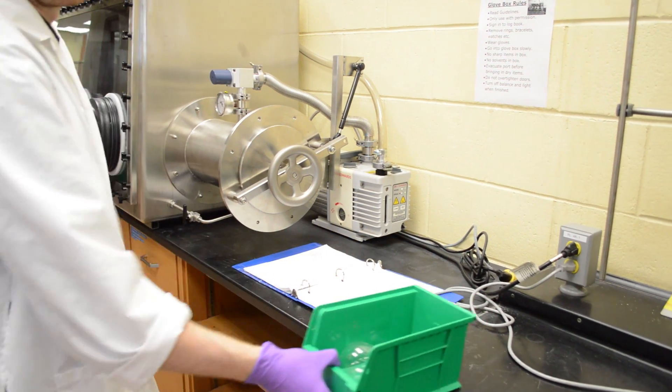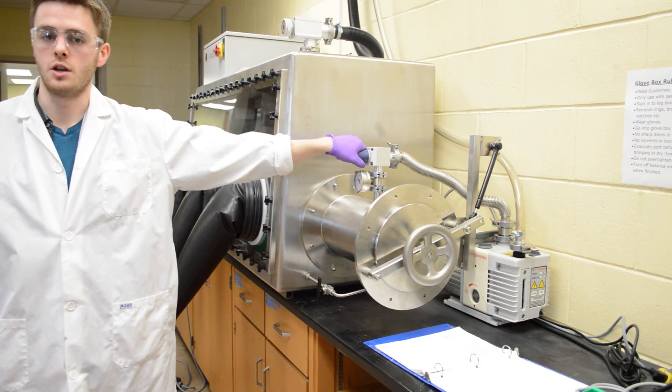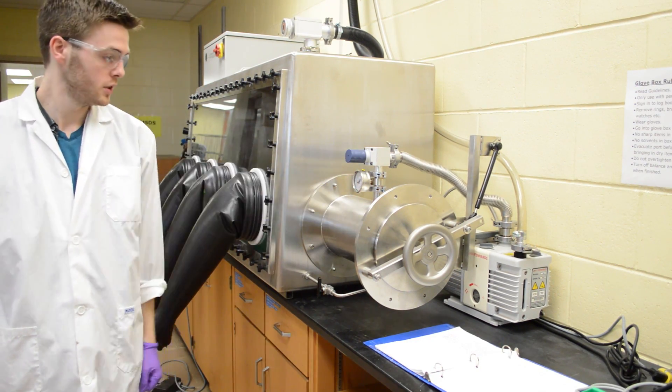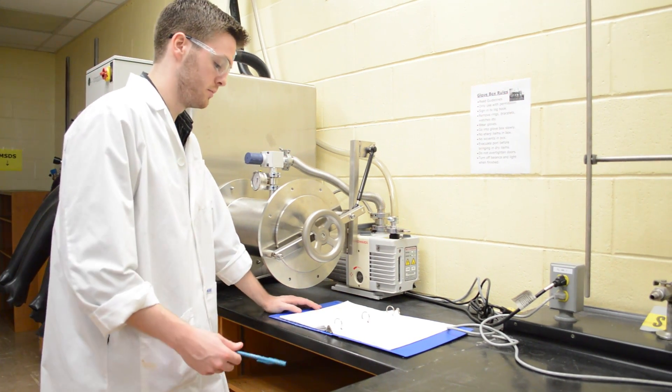And then it's ready for the Schlenk line. Of course, we want to evacuate this chamber again, which we'll do three times, which we've shown before. So whenever anybody uses the glove box, be sure to sign in using this logbook.